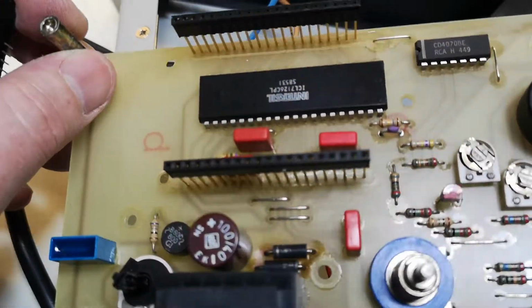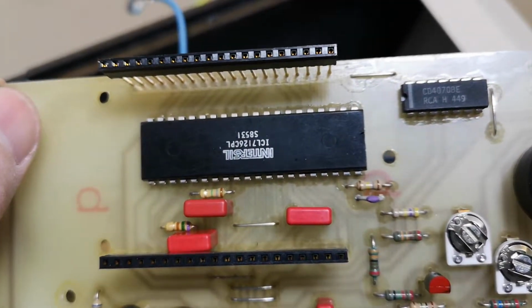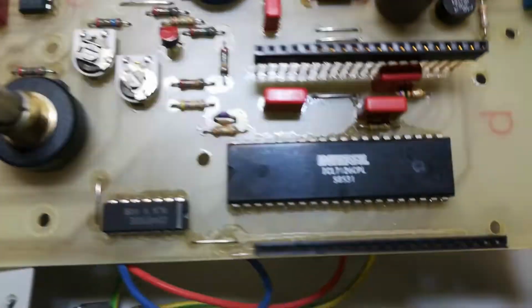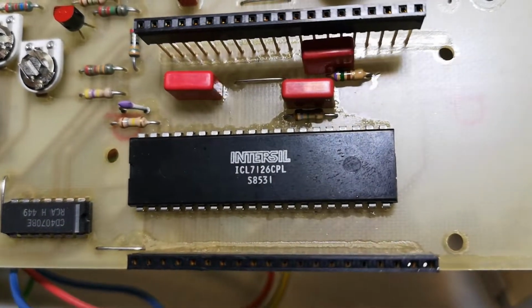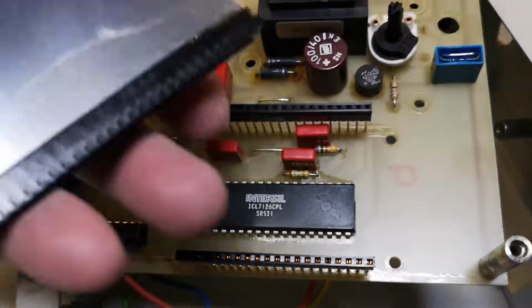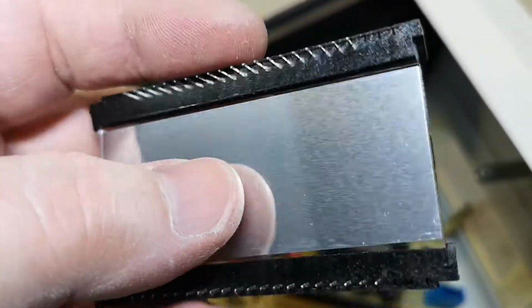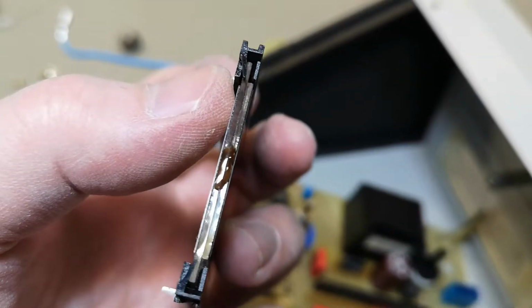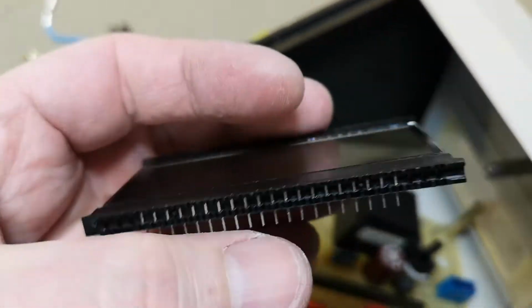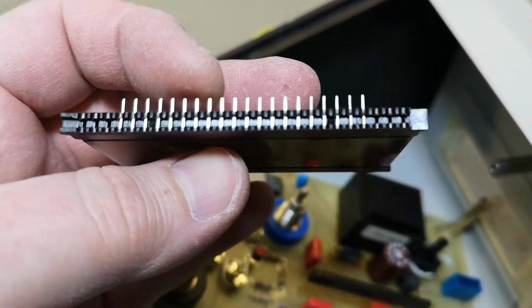And here is the LCD display driver. Or should we just do it the friendly way? And look at this. This is really nice. A snap-on connector for LCD glass and then directly into pins. Here we go. Super cute.